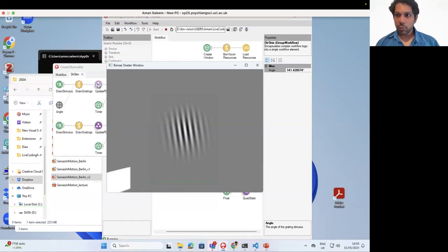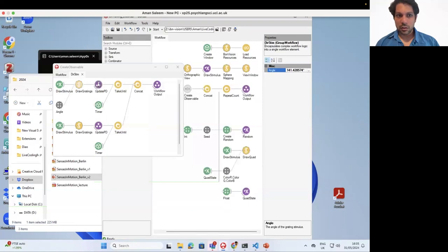And we've done that by putting a sync in the position after the stimulus comes on, and in the position where the stimulus goes off. So it's flipping between these two as the stimulus is going on and off. So basically, we can then record this, and based on that, we can sync up the two systems between the electrophysiology system or the imaging system using this photodiode. That's the basic way of doing the photodiode.